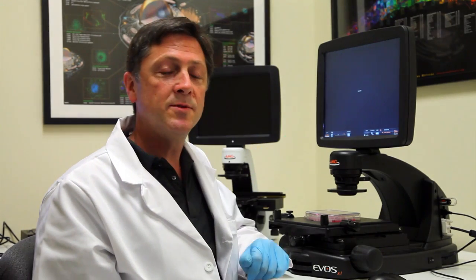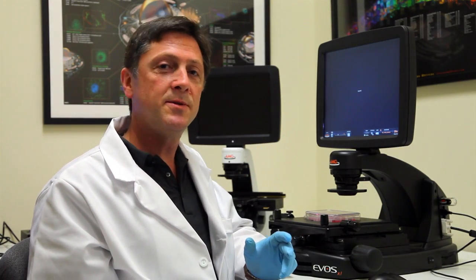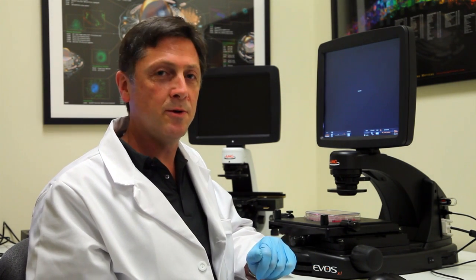I'm using the EVOS XL microscope. This is an all-in-one microscope that has a built-in computer and operating system software to do cell counting after you capture images. It has a built-in camera and a display. It doesn't use oculars. It's very comfortable to use. I'll just sit here, focus on my cells, capture the image, and switch over to cell counting and show you how that works.